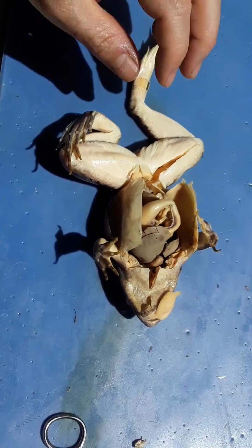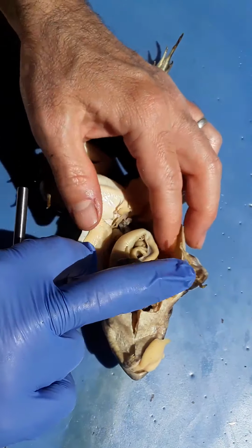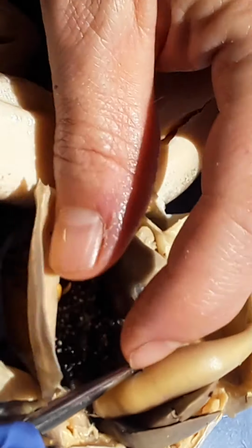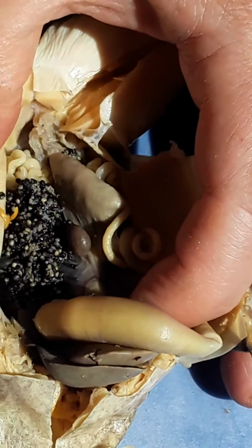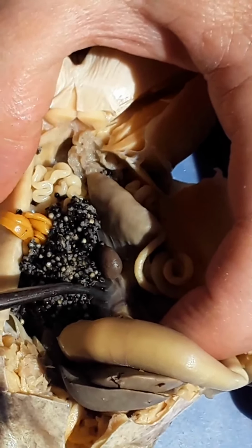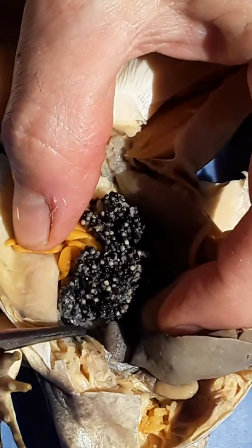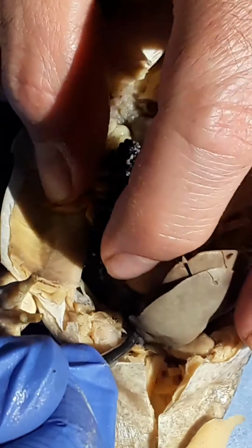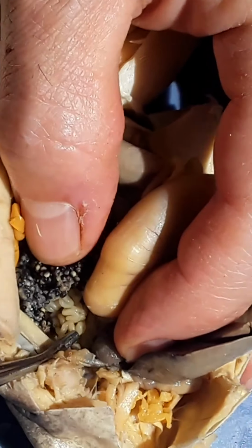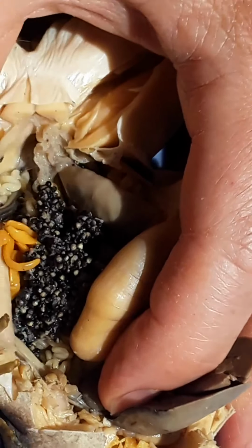And then I guess, yeah, the only other things are the urogenital system, which again is going to be underneath the liver, underneath the gastrointestinal tract. And then this is a female leopard frog, and we can see here are a bunch of immature eggs. Okay, so the ovaries are going to be underneath the lungs. Ovaries are up in here. Eggs here. Oviducts.